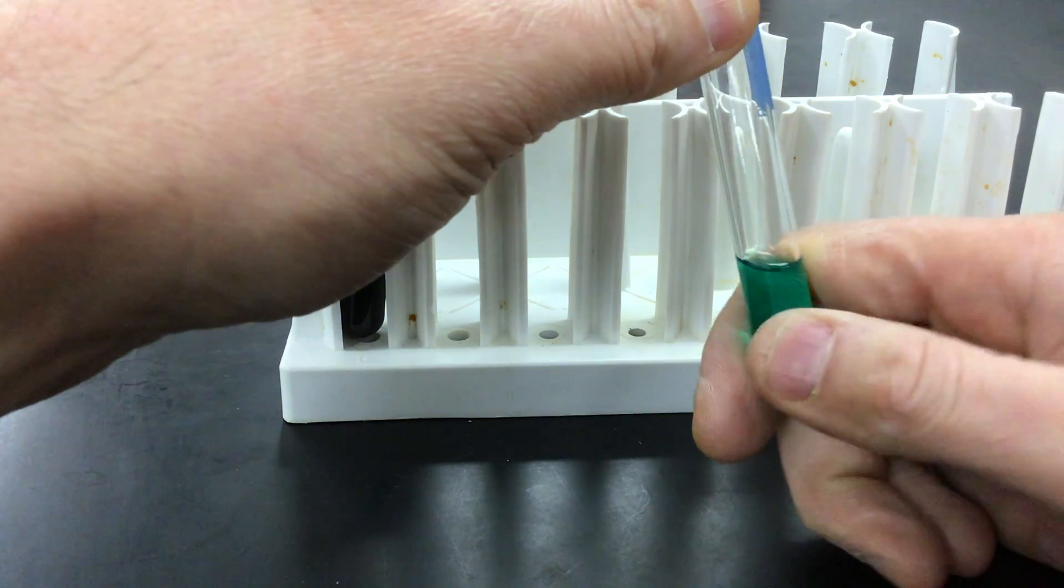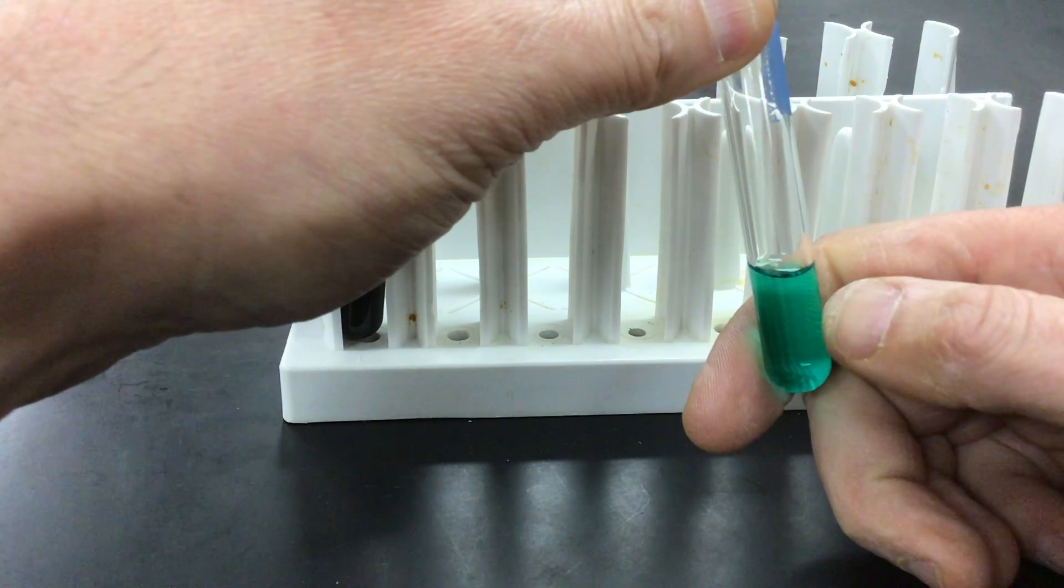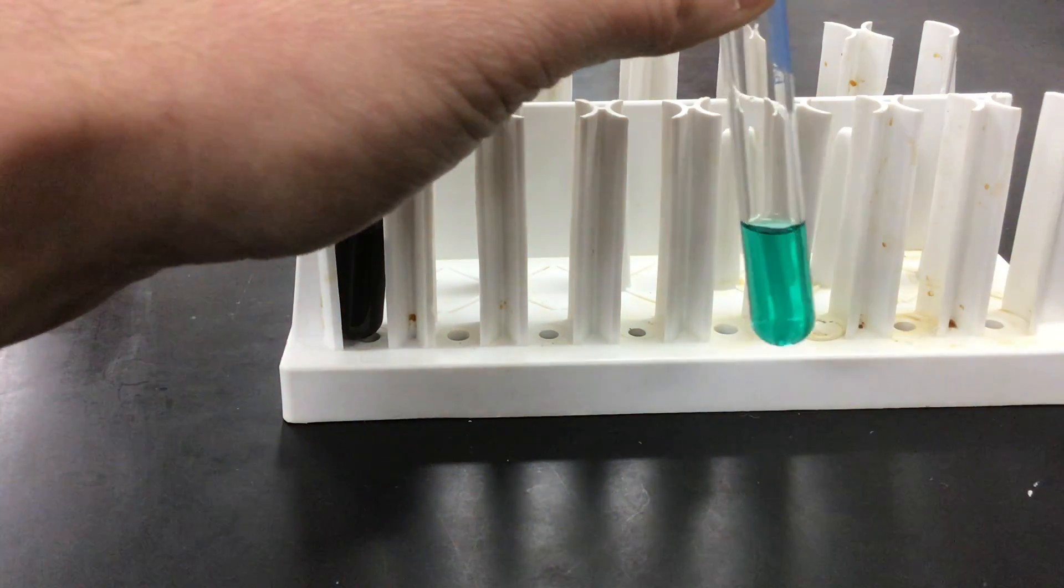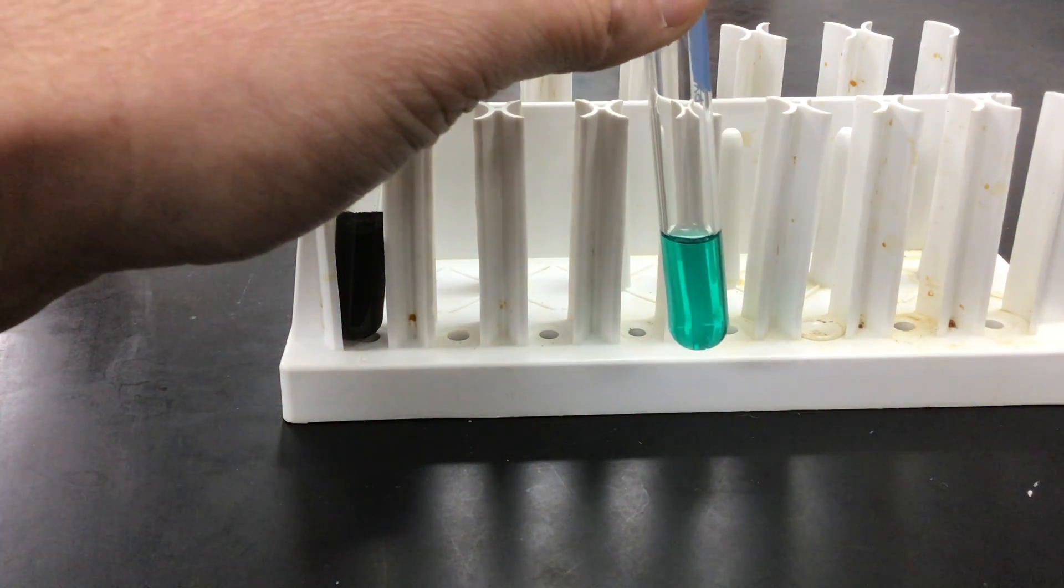When I feel the bottom of this test tube, it feels quite warm. It has gotten warm after the HCl has dissolved the copper oxide.